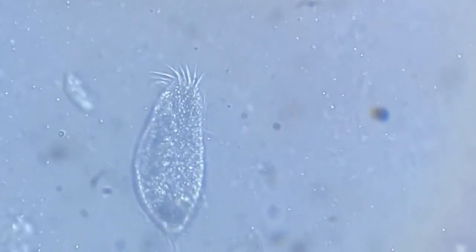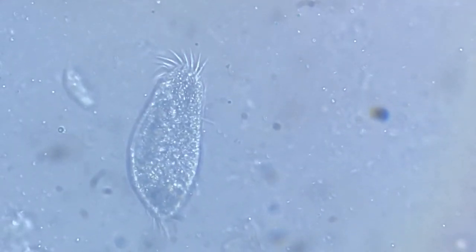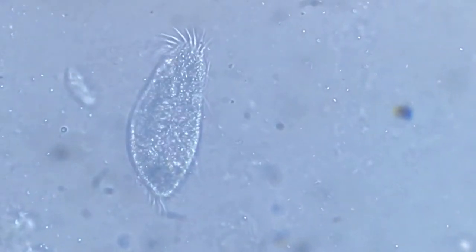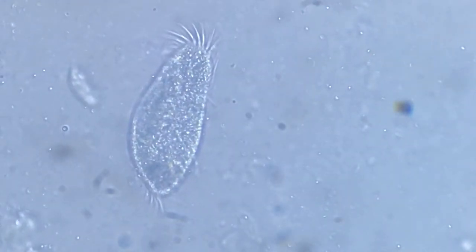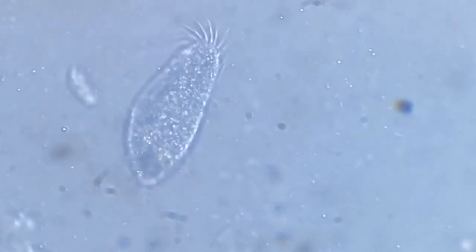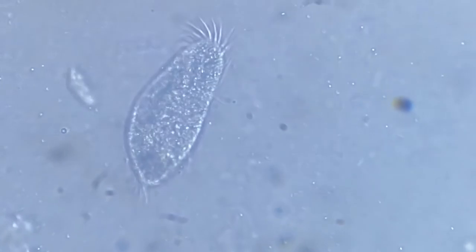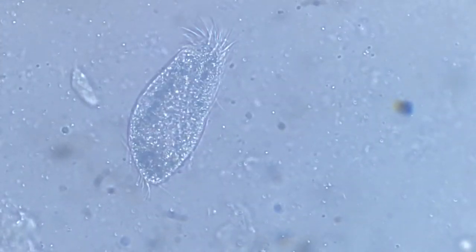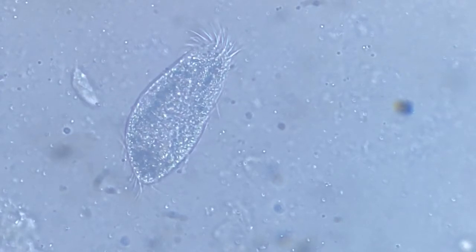For over a few minutes it had been moving aimlessly, but slowly I have noticed its tentacles giving way. Its cilia have become less moving, its movement has become less pronounced, and it is surely going to die. It's almost over with its actions.